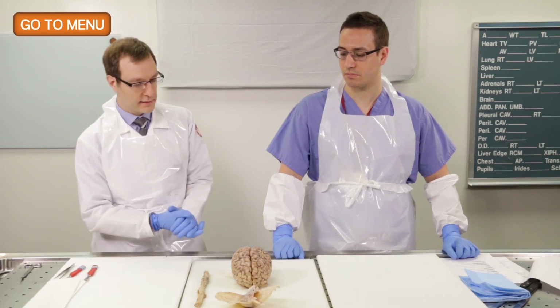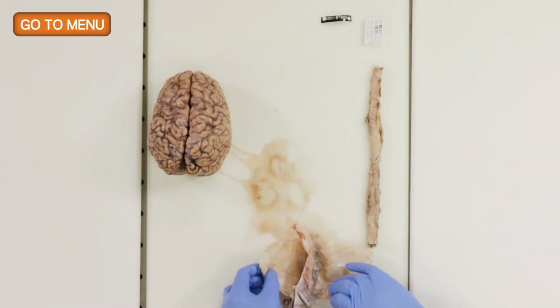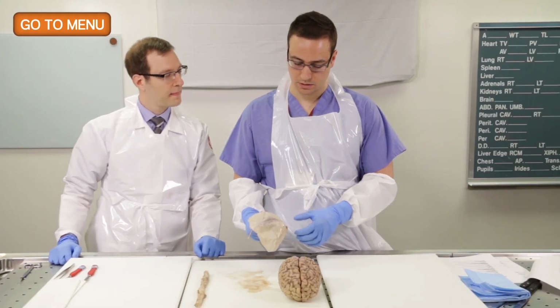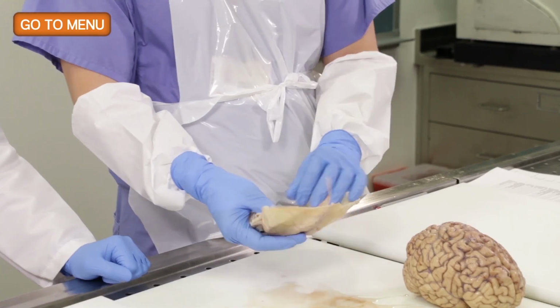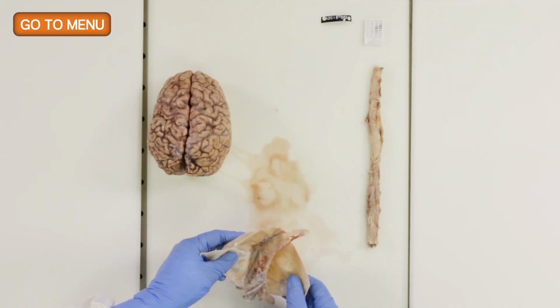So first, before we get to the brain, we'll look at the dura itself. So this is the portion of dura that was carefully dissected off by our Diener. And why don't you take a look at the dura and tell me what kinds of things that you would look for? Sure. So first we're looking at the external surface, looking for any lesions or masses here. I don't really see anything. It looks like pretty nice, healthy dura.